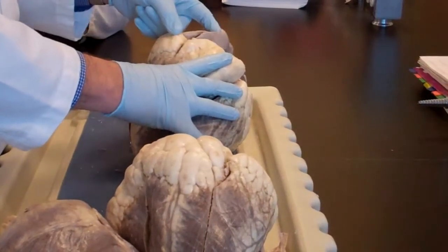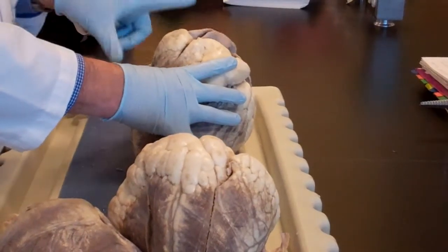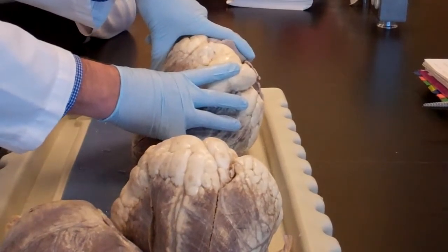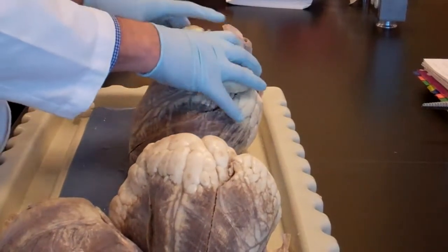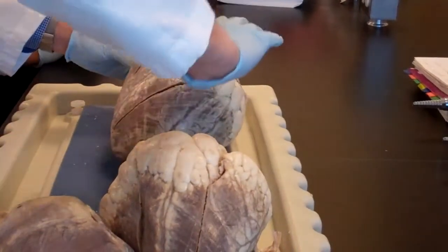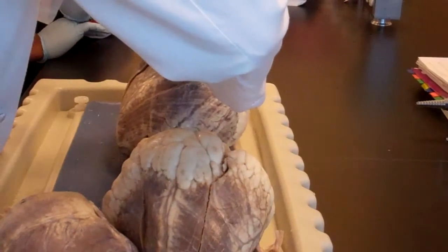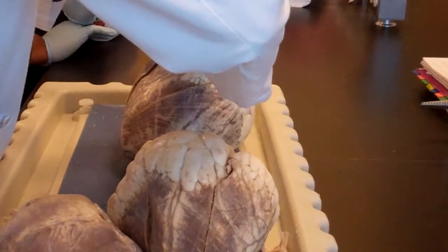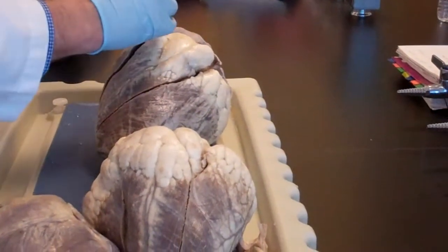Alrighty? And I see thick vessels, very thick, that are holding themselves. I see one that looks like a C shape, so probably this is the pulmonary trunk. And this is the aorta in the back. See? It's going this way. This is the left. It's going this way, in this direction. And the C shape is going this way. Make sense? You understand how and why they're this way?